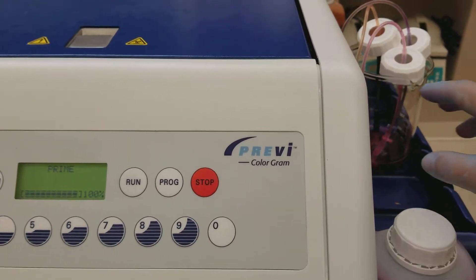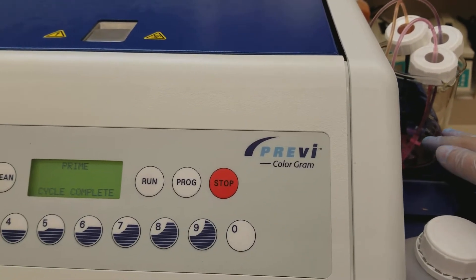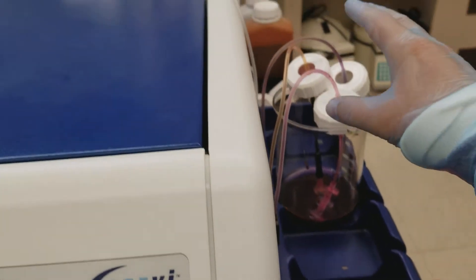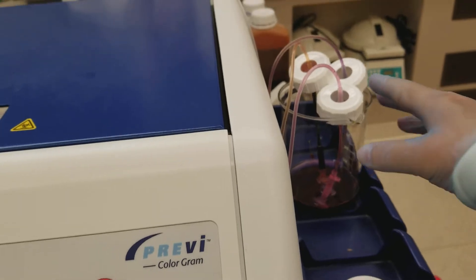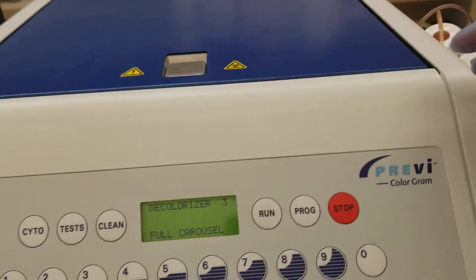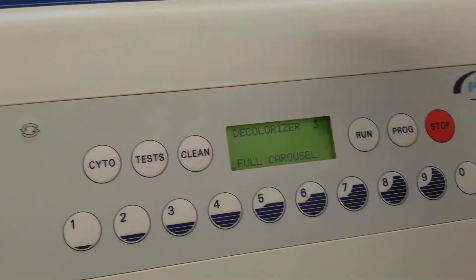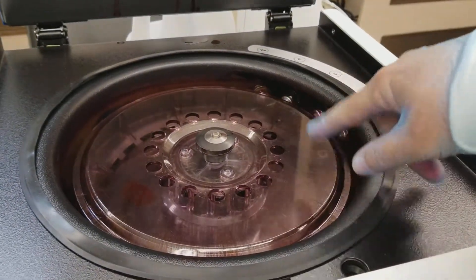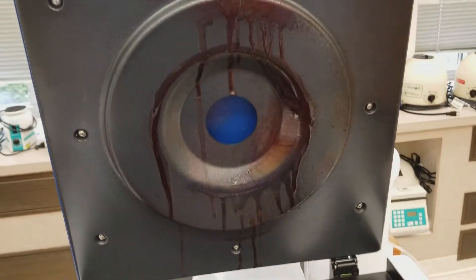I took those pieces out and put ethanol in a big beaker, then put all of the tops in there so that the ethanol will be primed through the tubing and out through the nozzles. You can see it's dripping all over the place.